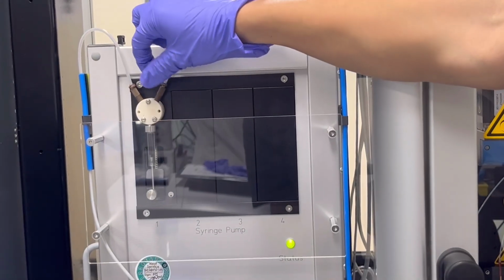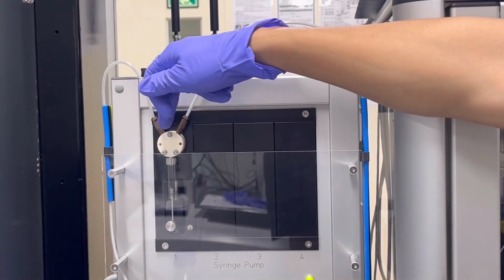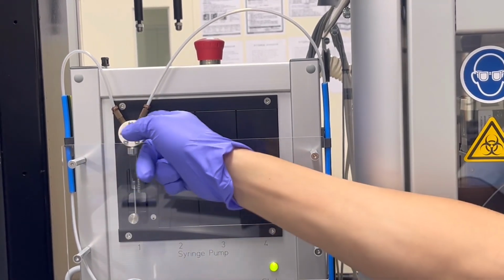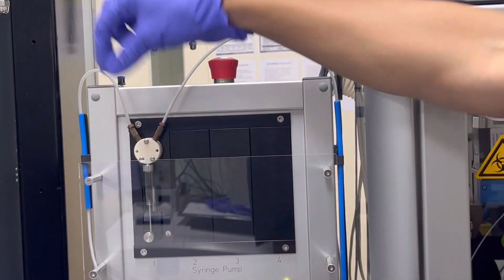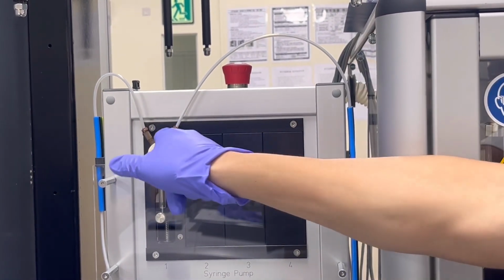And maybe they will tighten the screw here, so if there is an error during the work, we can see some water will leak. So we have to check and tighten the screw.